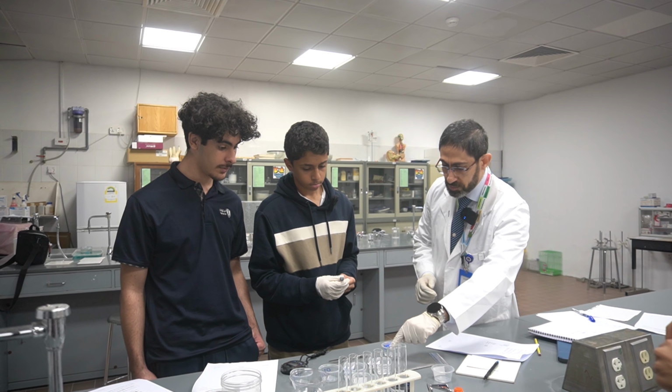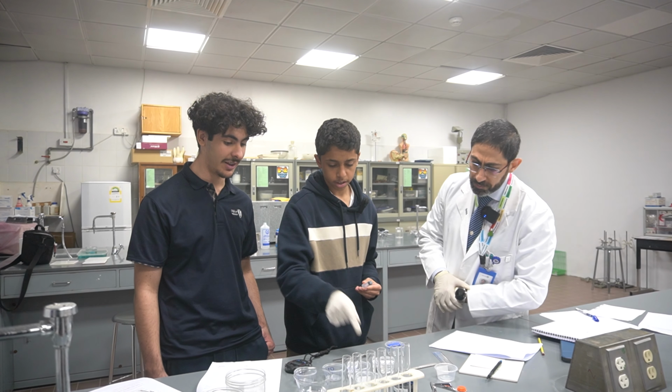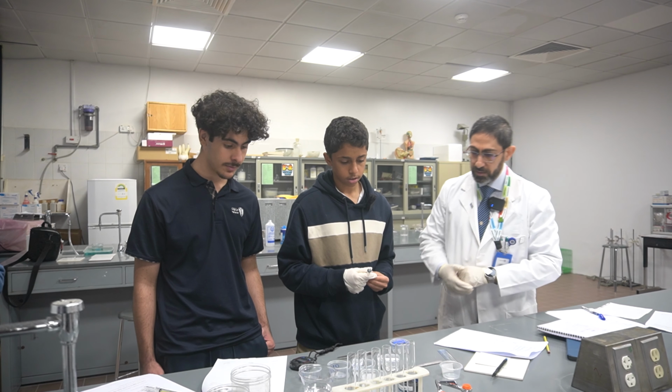Okay, you are writing the concentration on a paper? This is the first one. This is for before. Okay, this is 10%. This is 1%. This is going to be 0.1%. This is going to be 0.01%. That's perfect. Carry on.